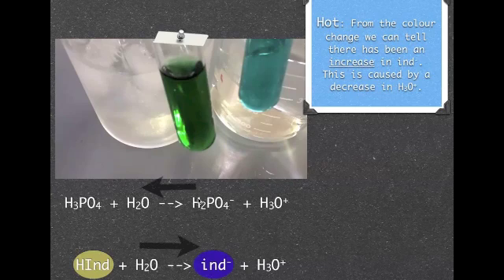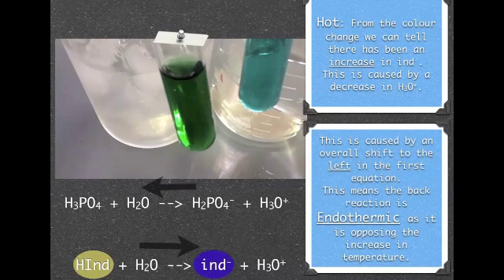That means, according to Le Chatelier, if you put a solution in hot water it will try and counteract that. So that means the back reaction here must be endothermic and that's what I've got here.